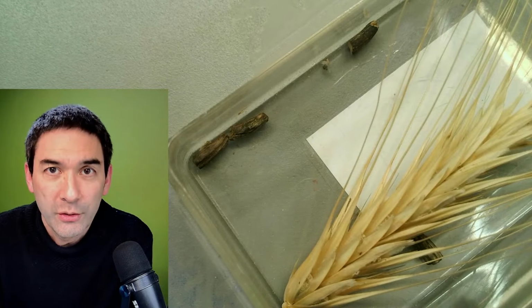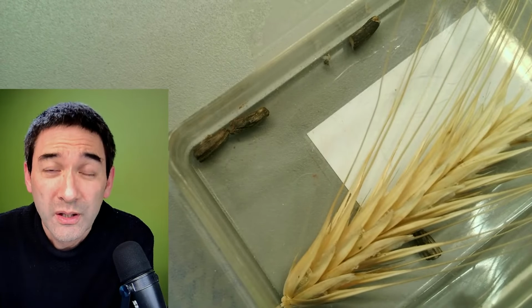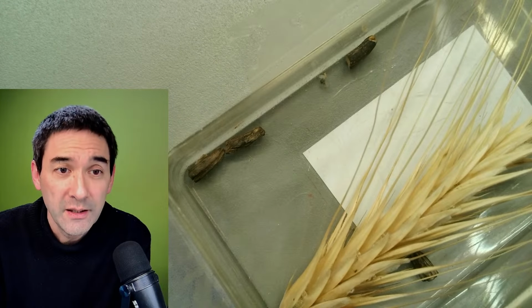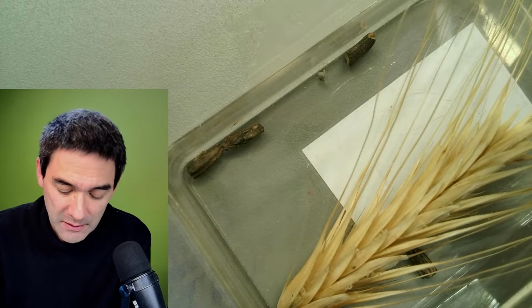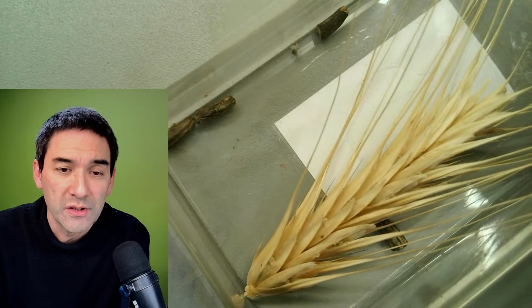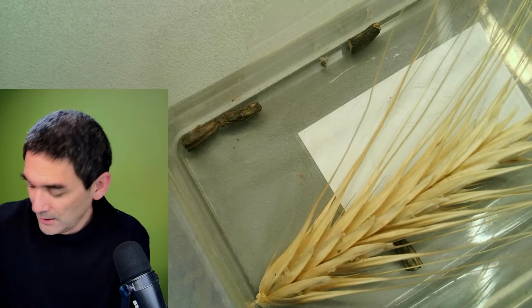whole villages died out because of that, right? If the baker... I know that was in the 1950s, there was a famous case in France where almost a whole small village actually died. People got hallucinations and all these things, because the bread was contaminated with those kernels. Right? The ergot. And what I'm going to do, of course, now is put it under the microscope. Okay, so yeah.